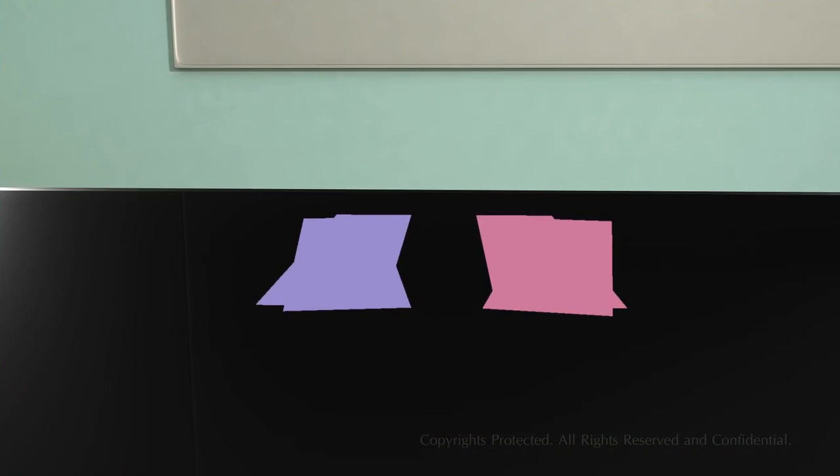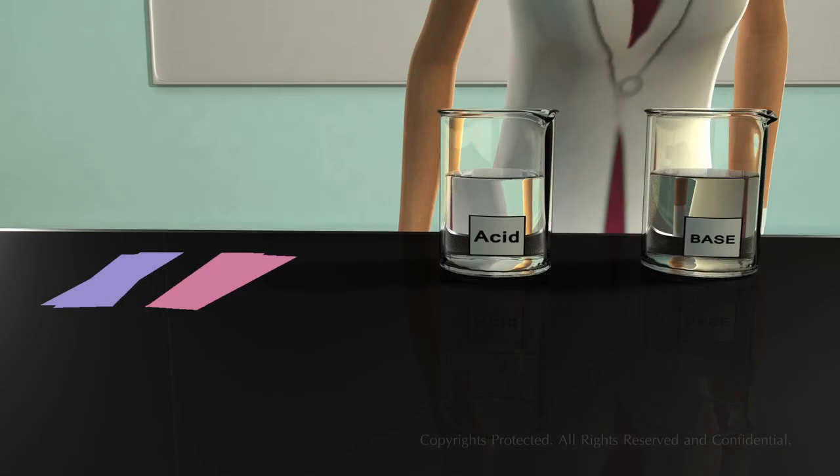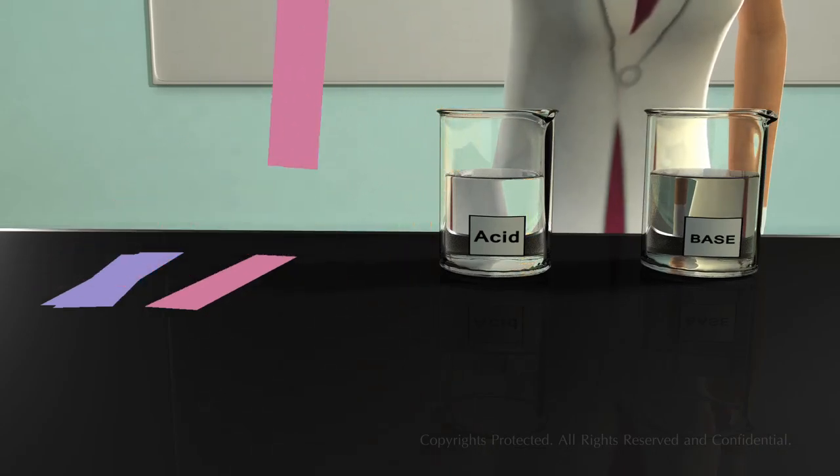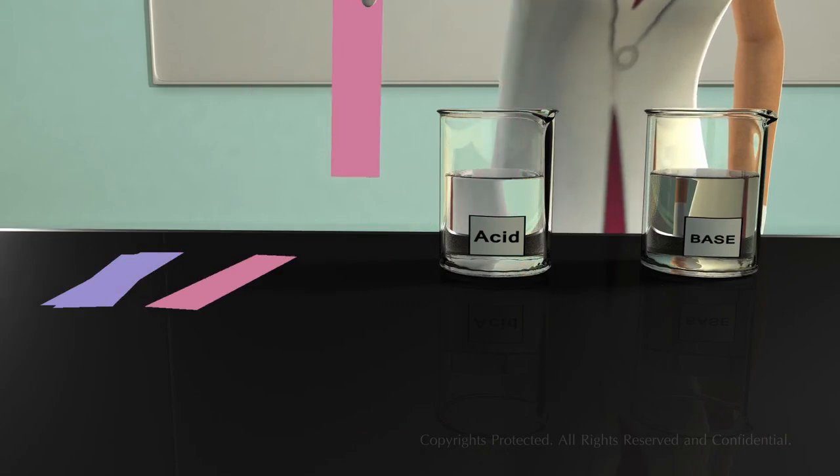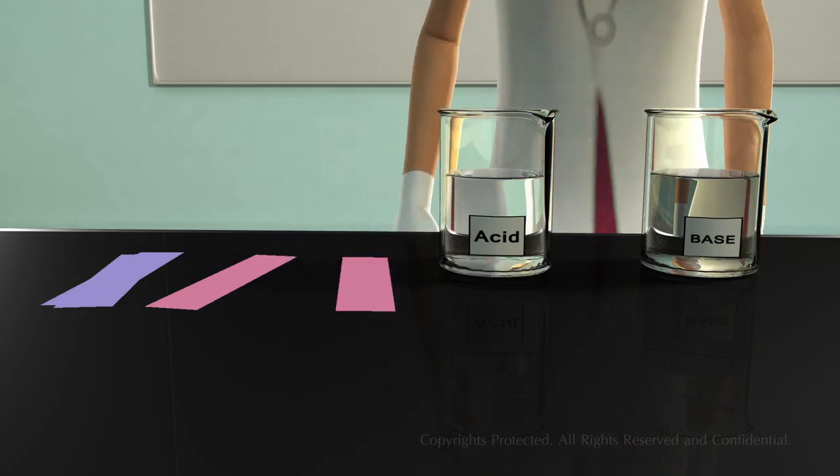Commonly used natural indicators are litmus papers. There are 2 types of litmus papers: red litmus paper and blue litmus paper. Take 1 red litmus paper and dip it in the beaker containing acid. Let us see what happens. There is no change in the color of the litmus paper.